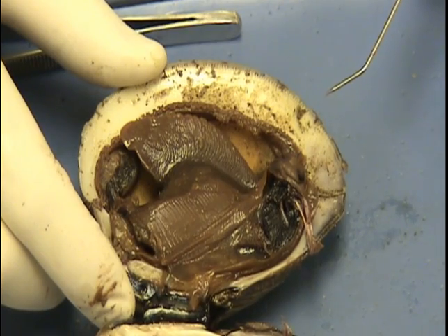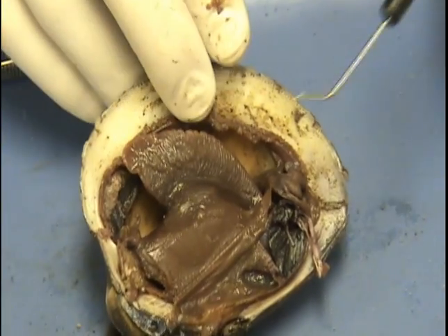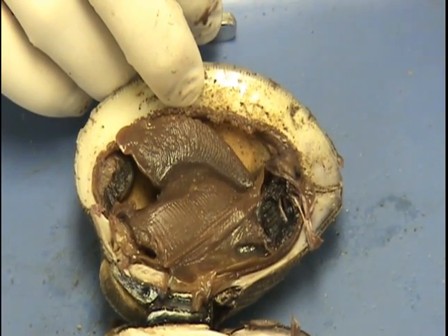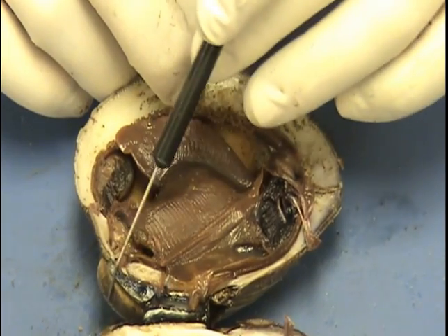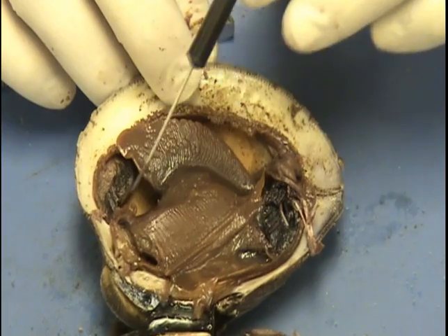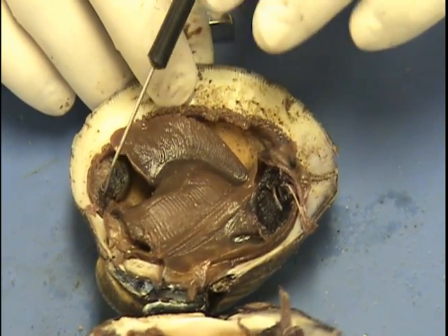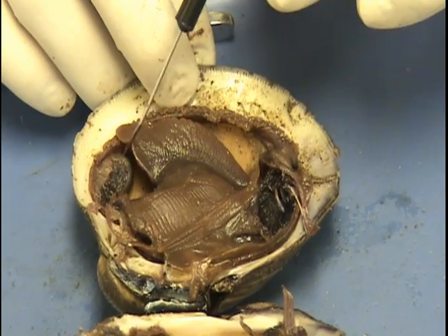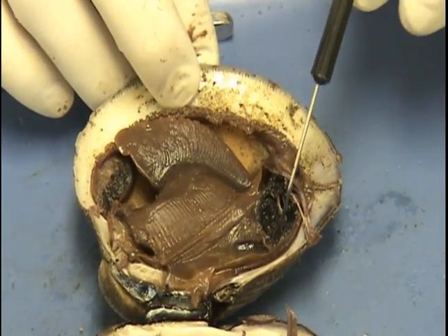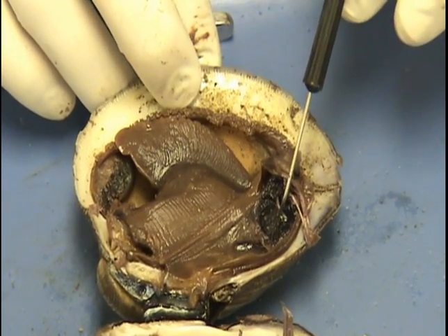The next thing is the anterior muscle. Remember, to find the anterior side we look for the umbo — there's the umbo right there. So the anterior muscle must be right here; this whole section right here is the anterior muscle. The posterior muscle is on the opposite side. So: anterior muscle, posterior muscle.